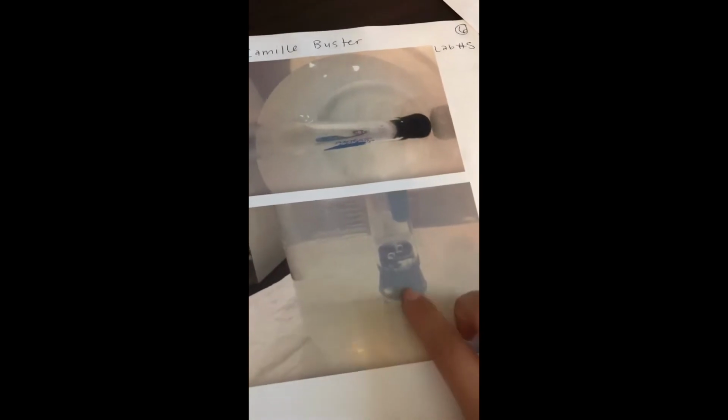Activity 3, we had the single replacement. Single replacement reactions replace a single element reactant with that of another reactant. In this activity, hydrochloric acid, water, and a magnesium strip were observed. Here is capturing a production of hydrogen gas rather than oxygen gas, which is observed with the introduction of the flame. So there's more pictures, and it started bubbling up here.